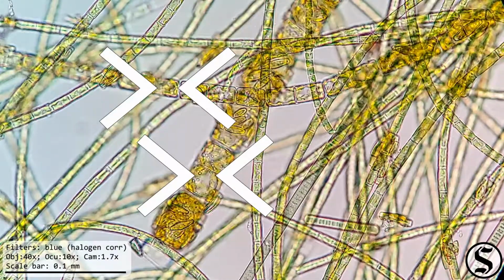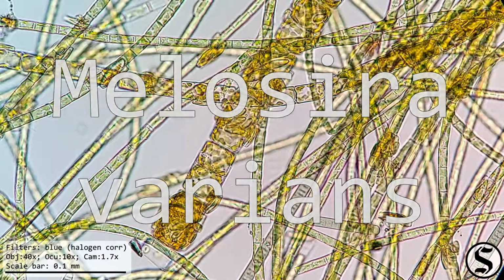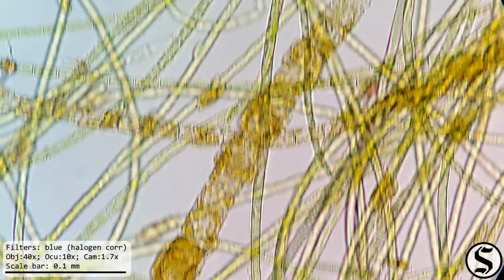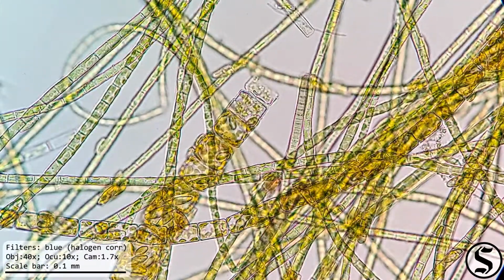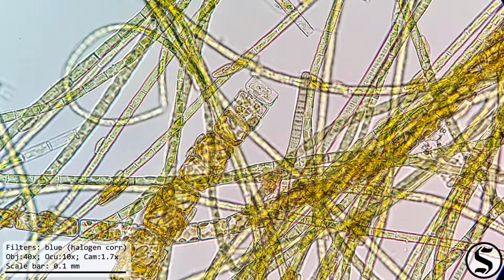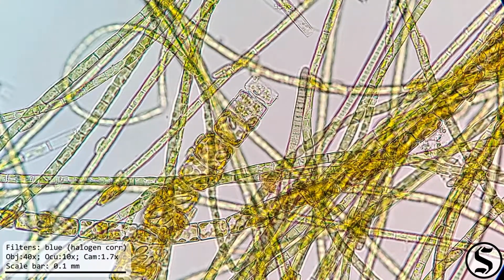The big yellow stuff, those are actually a type of diatom. Those are Melosira varians. That's a genus and species identification. The genus name comes from the Greek melon for melon and seira, chain. I can definitely see how that looks a bit like a chain of melons. And the species varians probably comes from the Latin varius, which means various or varied.